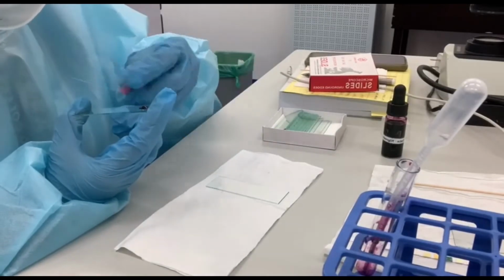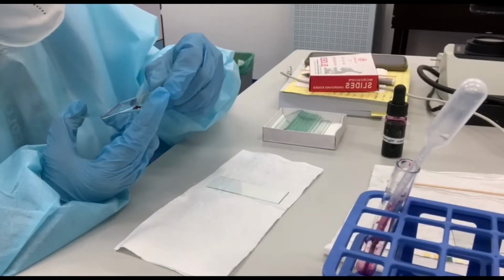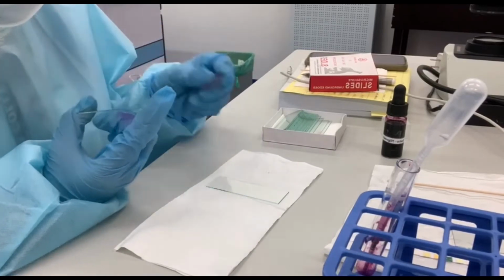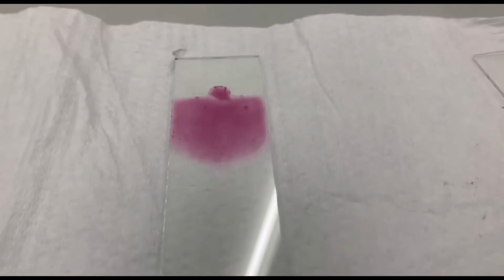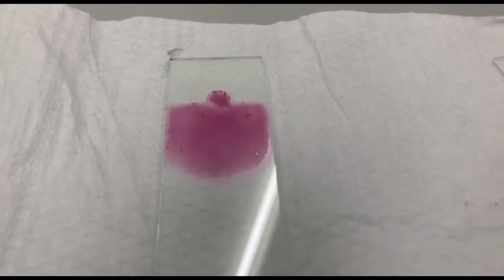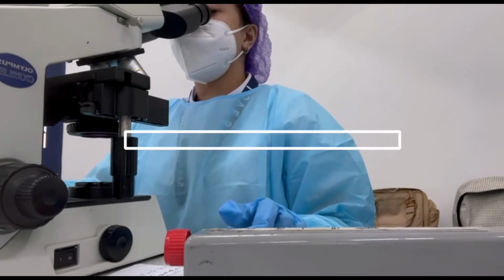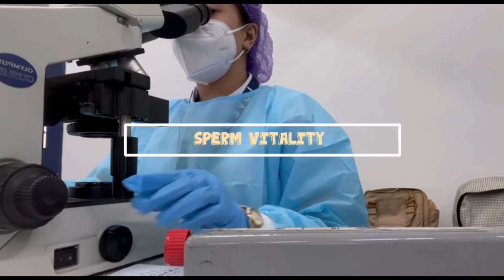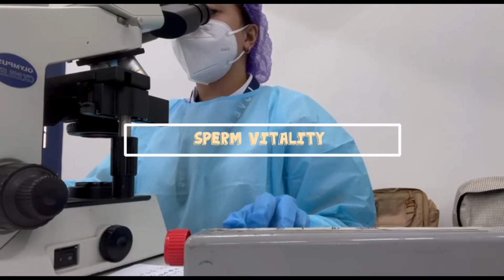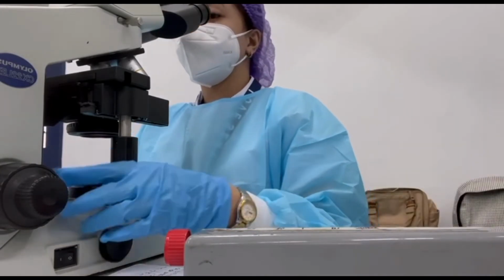After 2 minutes, make a smear and let it air dry before viewing under the microscope. Once dry, view it under the microscope using the immersion oil and OIO. Assessment of sperm vitality is an important component of semen analysis. It helps to distinguish spermatozoa that are alive and immotile from those that are dead.